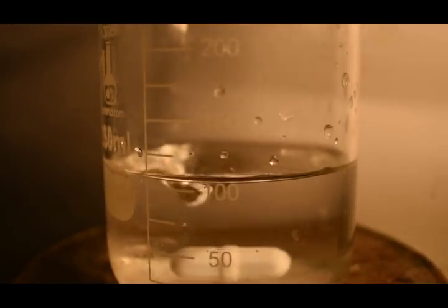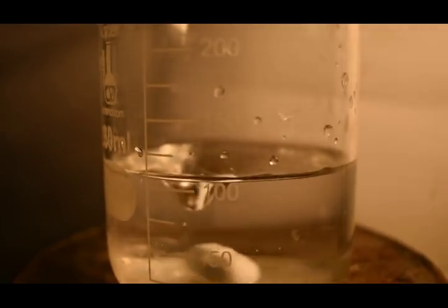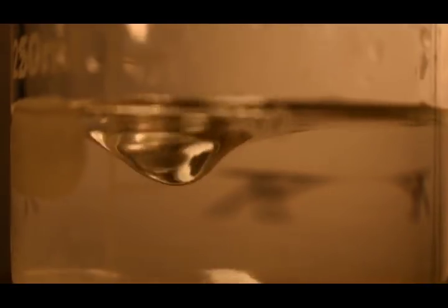Now that everything is dissolved, I can go ahead and add the silver nitrate solution. On second thought, actually, I want to get a good close-up of this. So I'm going to put on the macro lens I have and get you some nice close-up footage. Much better. All right, here we go.